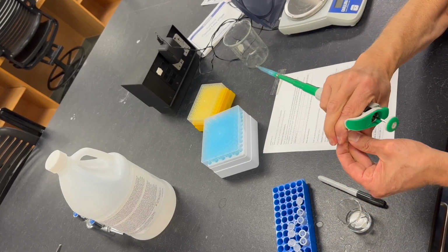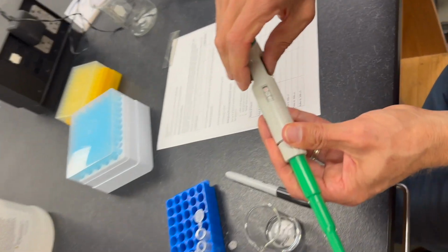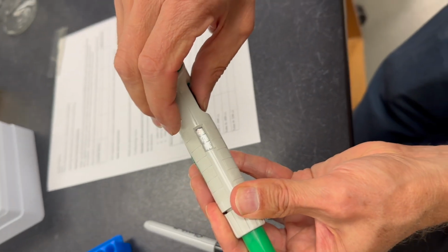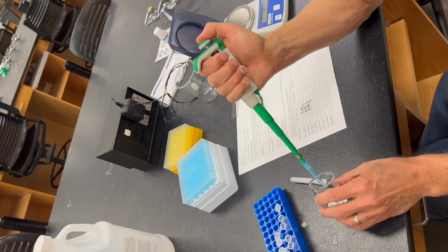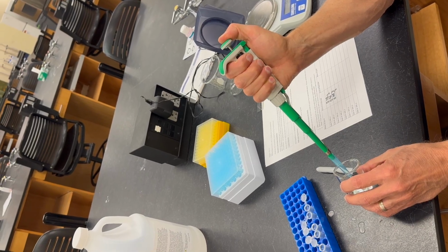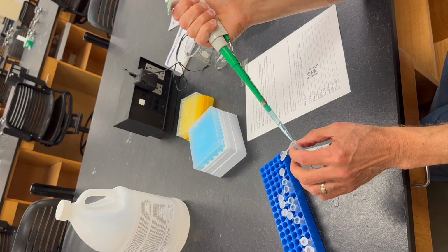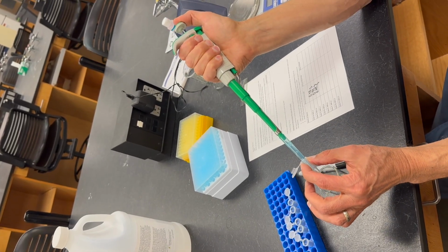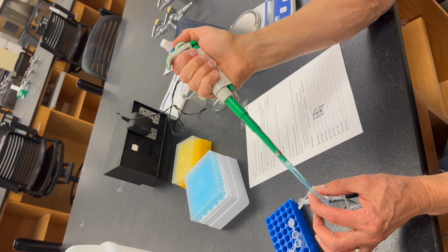Okay, so I will measure one more, which is at 650 microliters. I'm going to dial it down to 0.65, which is 650 microliters, and measure this in the same way that we've done the others. And again, I'm making sure that I'm putting the pipette tip against the side of the tube so that all the liquid drains out of the pipette tip.